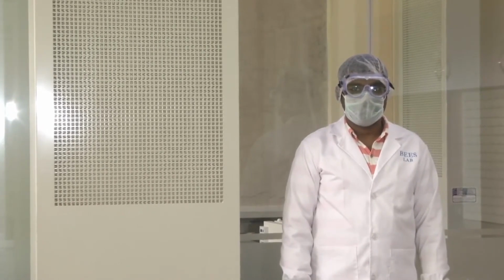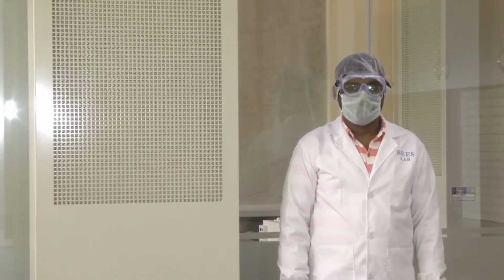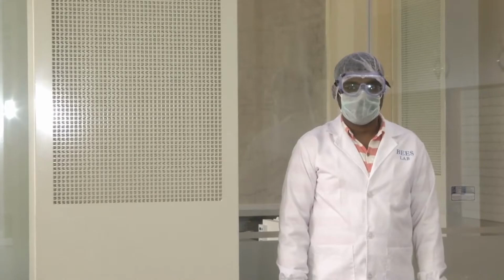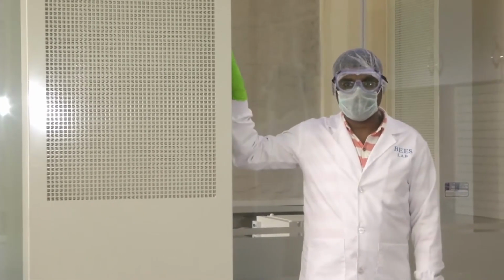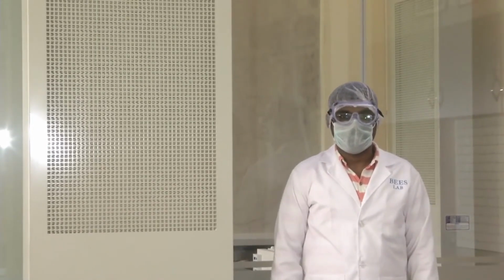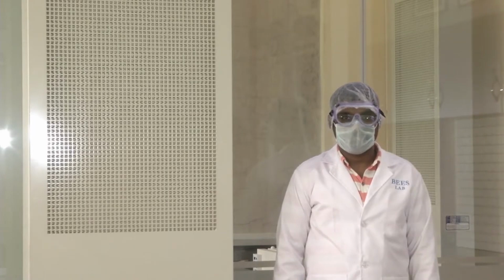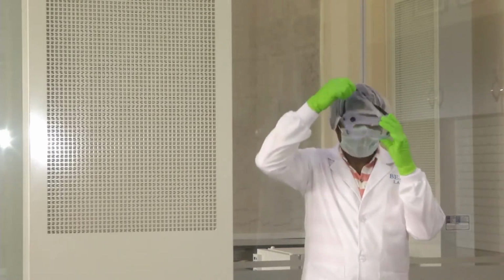Once this positive pressure module pumps clean air into the lab, this air needs to be circulated. The tower modules which we saw, which Sitaram will again point to, will ensure the circulation of air within the lab. So these two systems have to work hand in hand along with our good lab practices to maintain the particulate matter count within the lab.